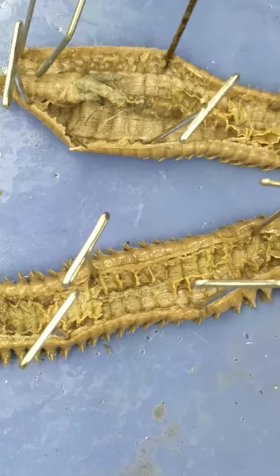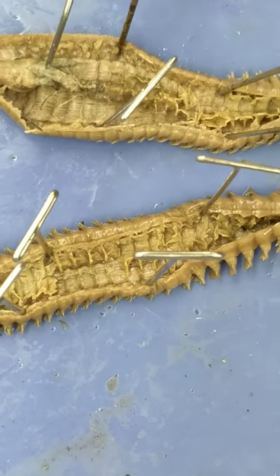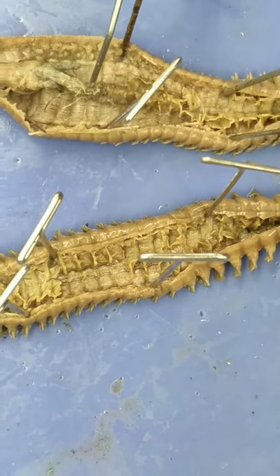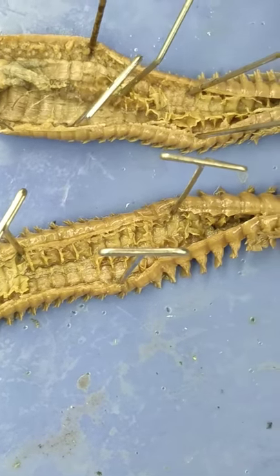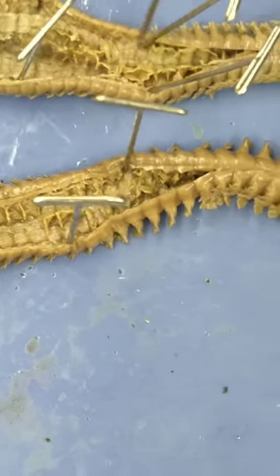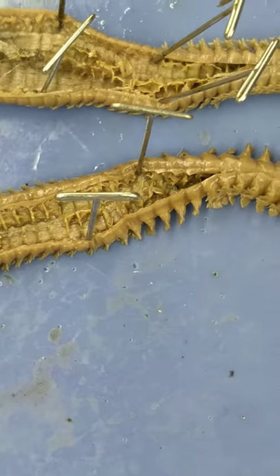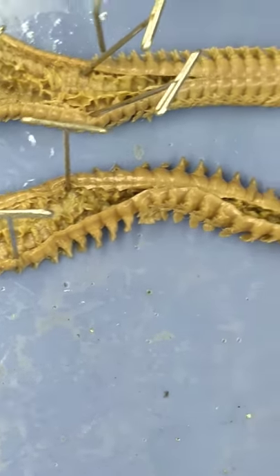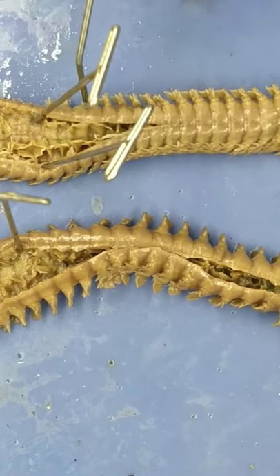And then this is the pharynx, this is the esophagus, and then down we have the intestine, and then on the side here we have the parapodia.